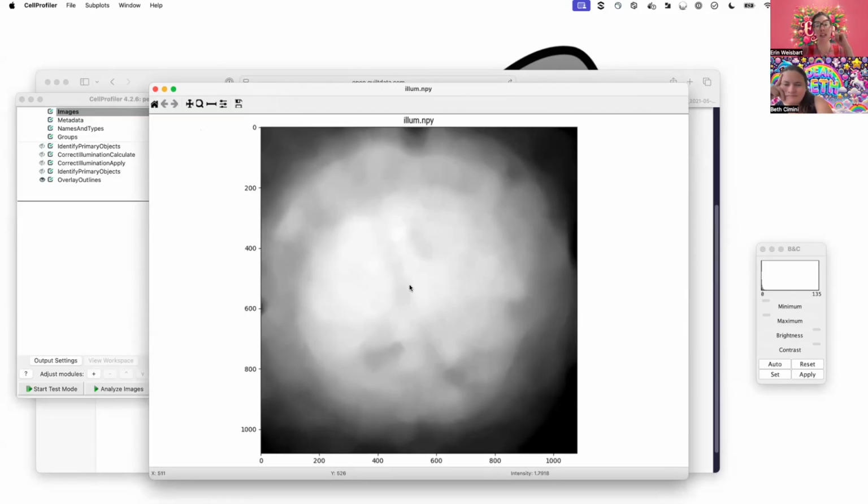And at the darkest of the dark points, we're going to get an intensity of 1. Intensity of 1 at the darkest of the dark. But then as we get to the brightest here, there's almost a twofold difference between the darkest points in this image and the brightest, having to do with the actual objective itself. So if I were trying to measure the difference between two different cells, that could give me a super different result.